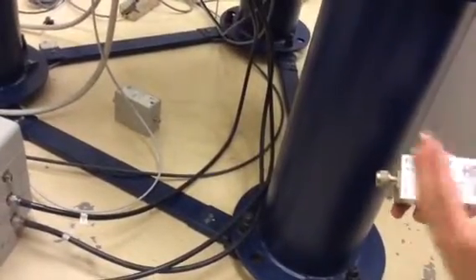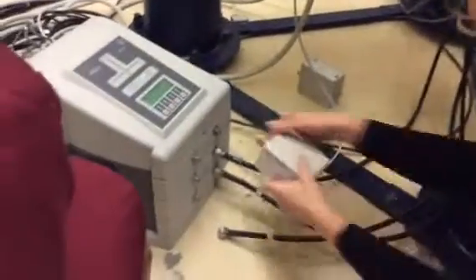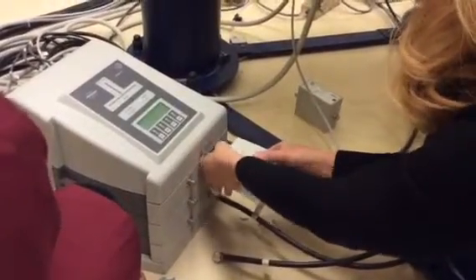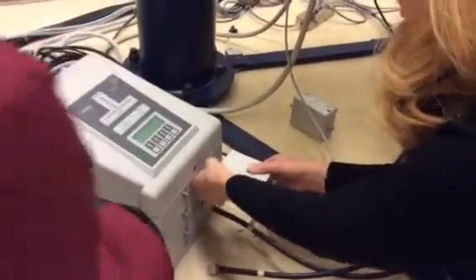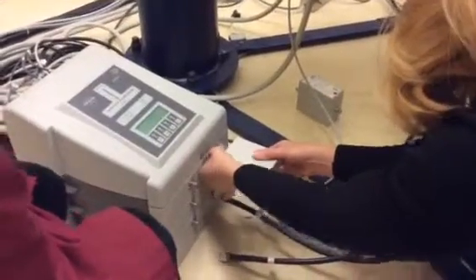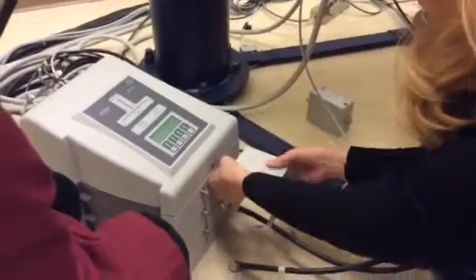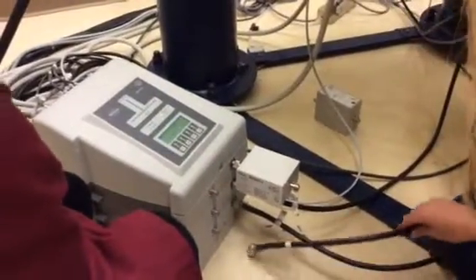Okay, so it's kind of like a band stop, so it'll stop the F19 signal. So we're going to put this on here. This is called a high pass filter. So again, you can think of it as passing all high frequencies. Proton only. F19 it should stop. Okay, I'm going to let you do this one.